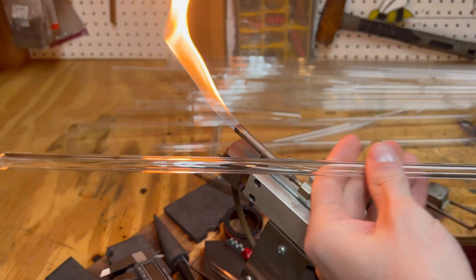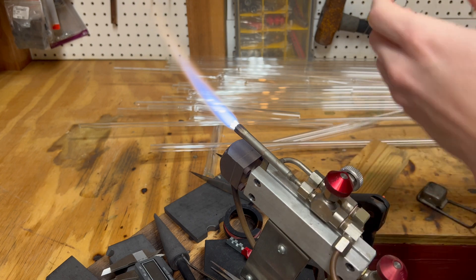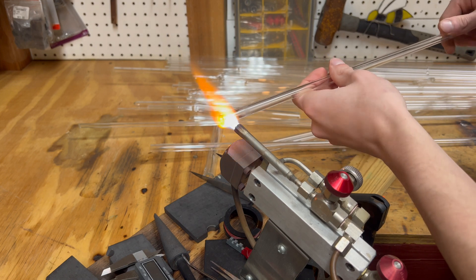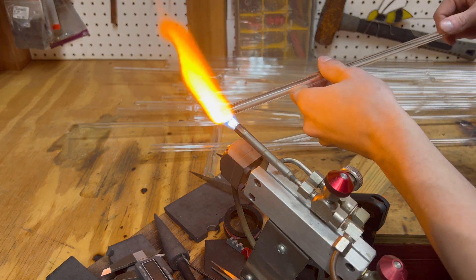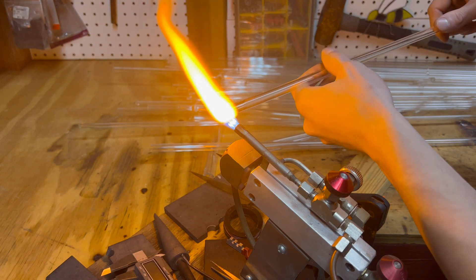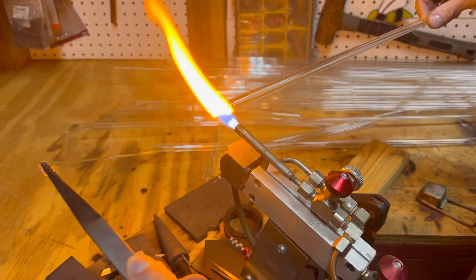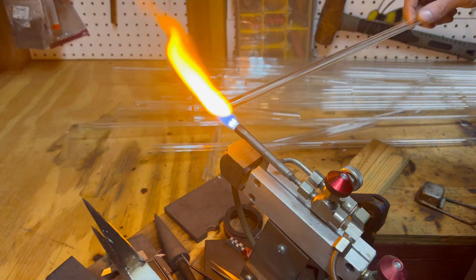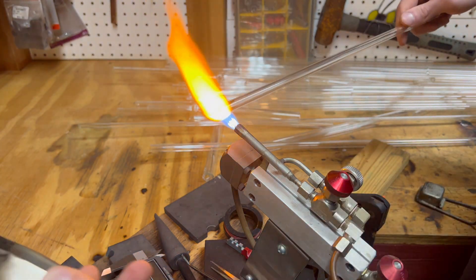Now I need to make the vessel capable of withstanding heat, and then being sealed with nitrogen. I would also like it to be at a low pressure to get a discharge going. For this, I'll be using some standard 10mm tubing. First, I'll make a test tube end on one side.